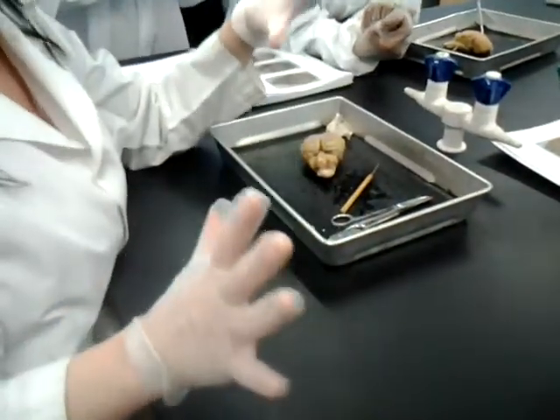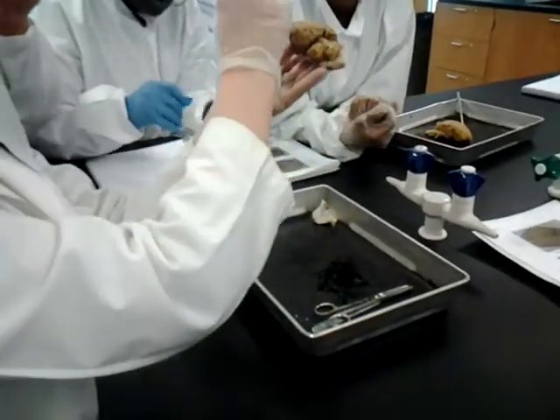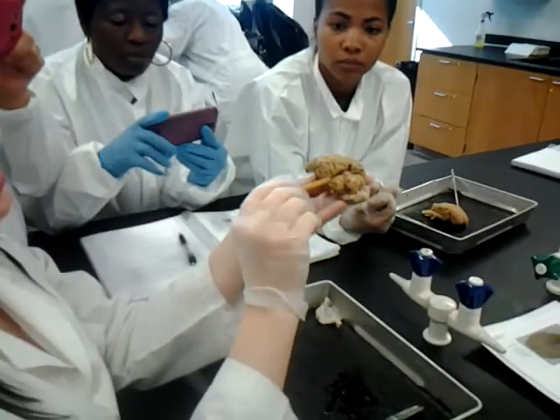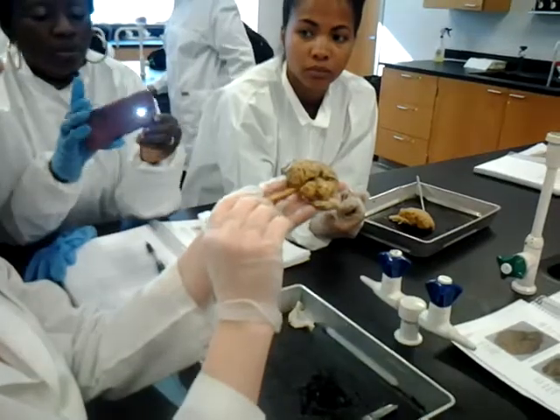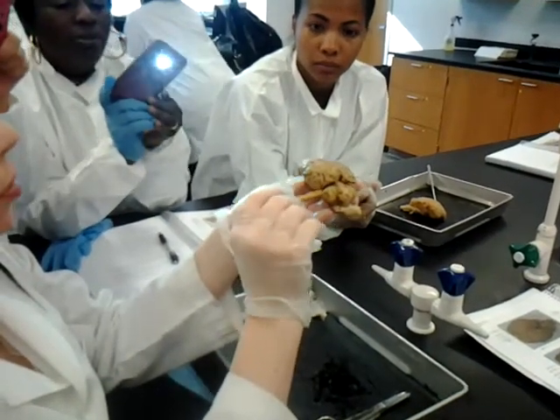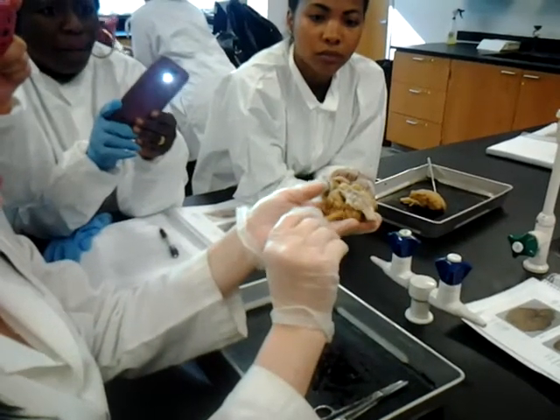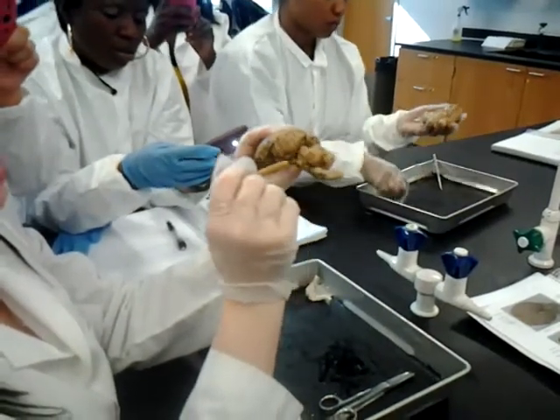Superficial stuff that hopefully you were already going through and being able to identify, but let's make sure. This main portion, of course, is the cerebrum. Cerebellum: B for bell, B for back. Cerebellum is in the back. Some people are confusing the cerebrum and cerebellum on this. Then brain stem here. All of this, cerebellum.